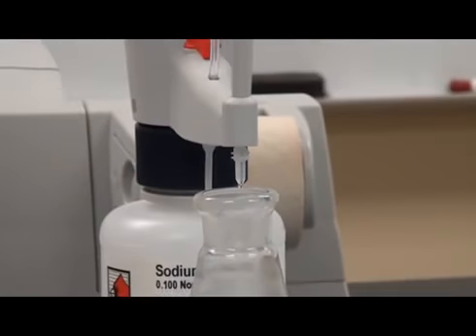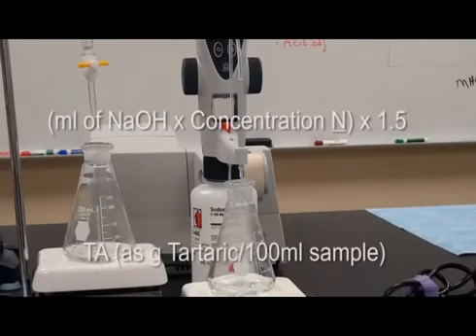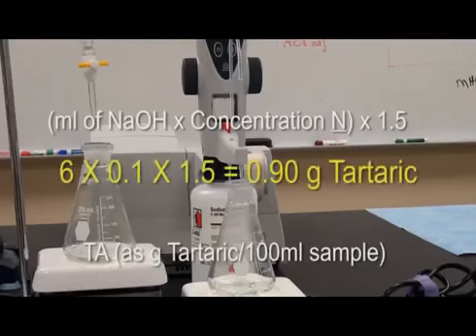The titratable acidity is calculated using the following formula. TA as grams tartaric per 100 ml sample equals the number of milliliters of sodium hydroxide used in the titration times the concentration of that sodium hydroxide, or N, multiplied times 1.5. In this example, 6 ml of sodium hydroxide, a 0.1 normalized solution, times 1.5 equals 0.9 grams tartaric. Record your findings.